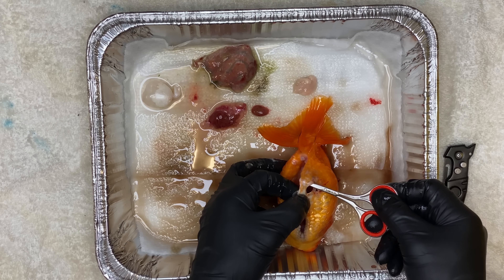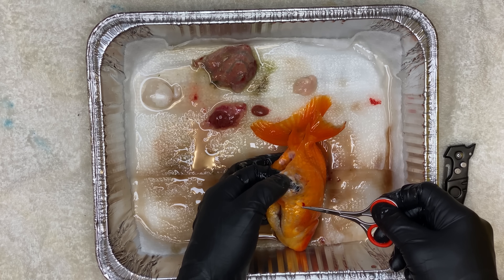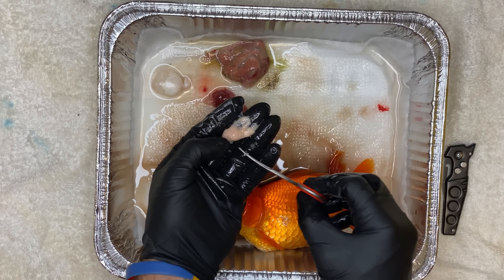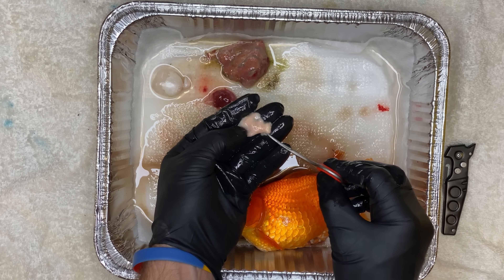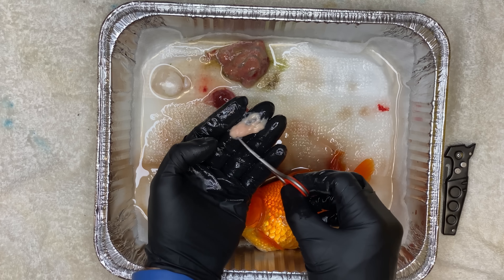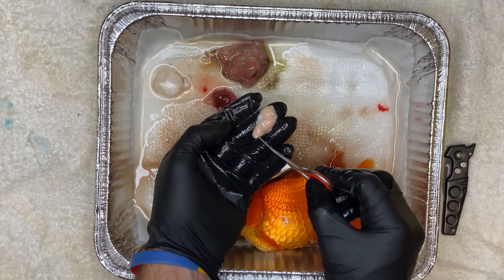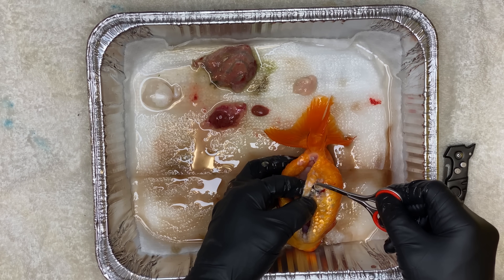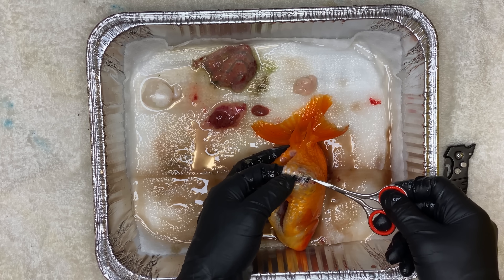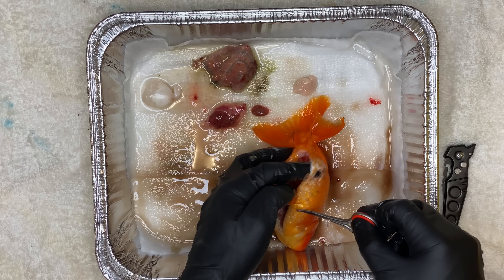It looks like there's a fistula from the body cavity straight to outside, and it looks like at one point her body slowly ruptured, which became the way the fluid inside her started going out. I believe the reason her reproductive tract ruptured — or got clogged up and started filling with fluid — is that she was egg-bound. The eggs at some point created a blockage that did not allow them to be expressed, causing them to disintegrate, get infected, causing an inflammatory response, fill up with fluid, and that blockage simply could not leave her body, eventually causing her entire body cavity to rupture.